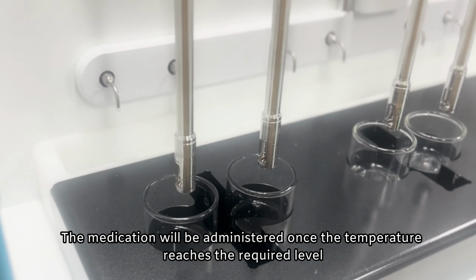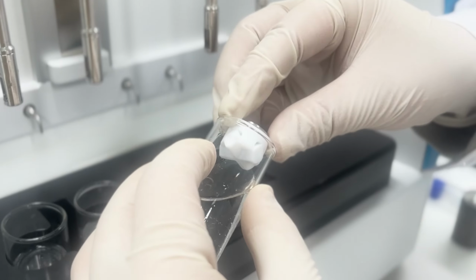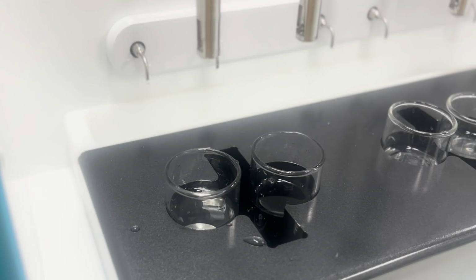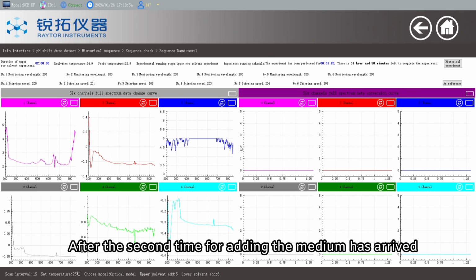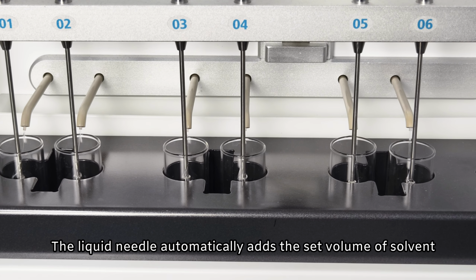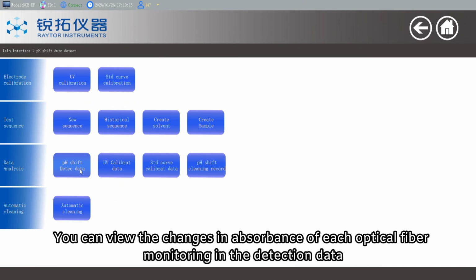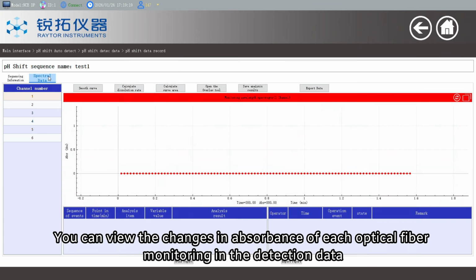The medication will be administered once the temperature reaches the required level. After the second time for adding the medium has arrived, the liquid needle automatically adds the set volume of solvent. After the experiment was completed, you can view the changes in absorbance of each optical fiber monitoring in the detection data.